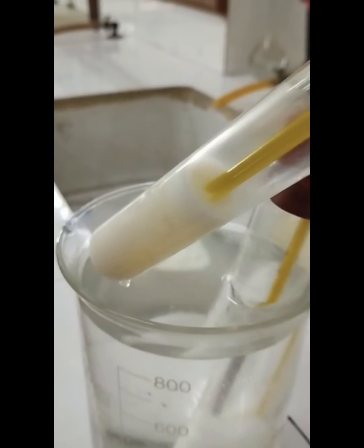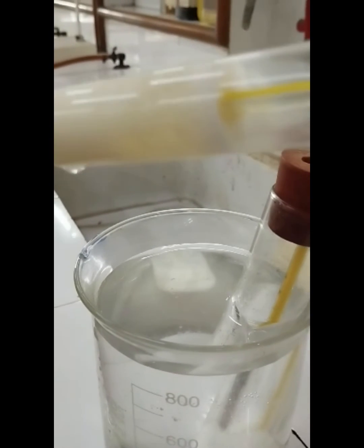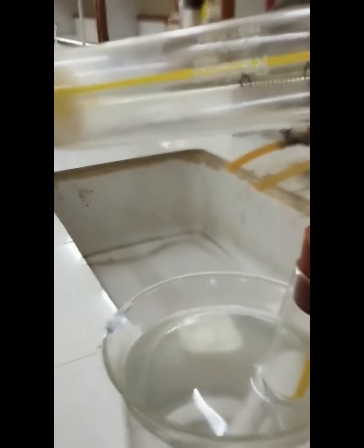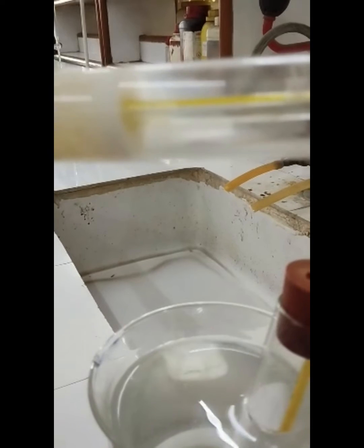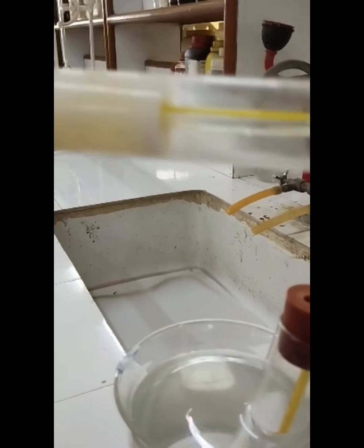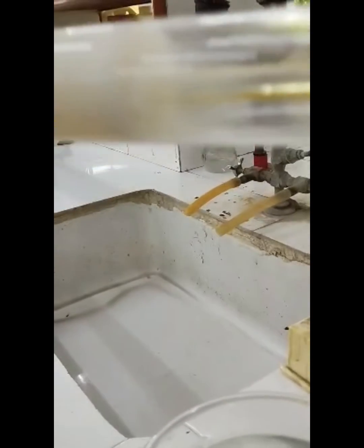It is just below the freezing point. You just don't have to freeze it — you have to see what was the last temperature up to which it was flowing. Now you can see this round bottom tube — the oil is still flowing. Inside, the oil is there and a semi-solid portion is there, so it is not completely solidified. That means the pour point has not been reached, so you have to put it back in the ice chilled mixture and let it intensify.